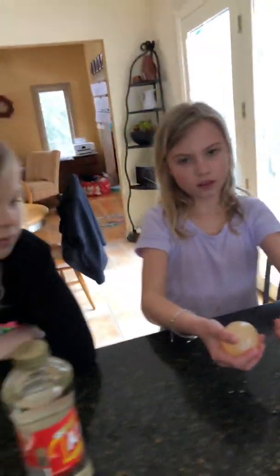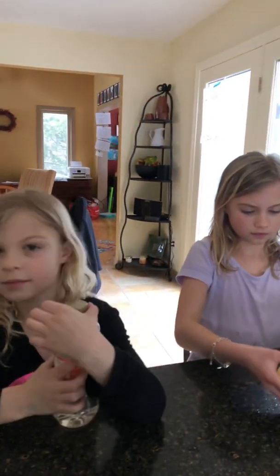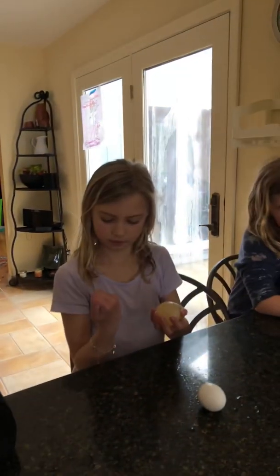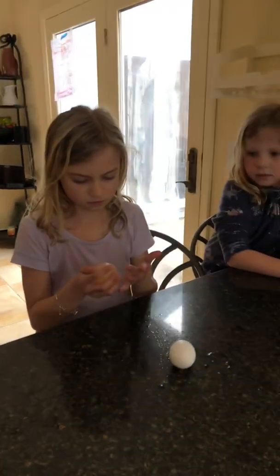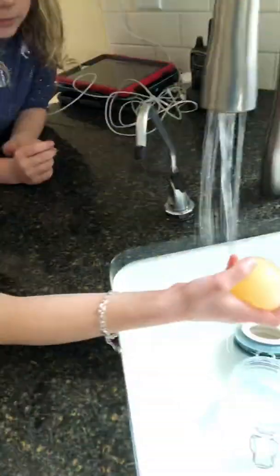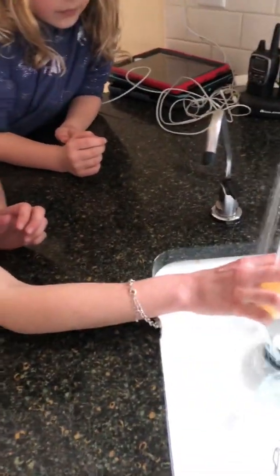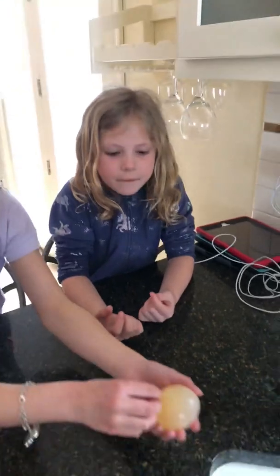Okay. So everything that you guys just said would be added to a lab report. Now, which section of a lab report would it go into? I'll give you some choices. Would it go into the materials section? Would it go into the procedure section? Or would it go into the results section? Results. The results section is correct. And every observation that you just made would be included. Every one of those observations will go into the results section. And you will want to clean it a little more, because there are some bubbles.